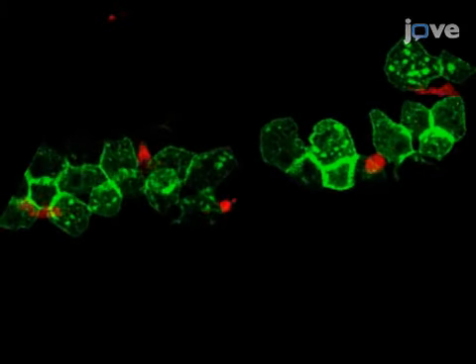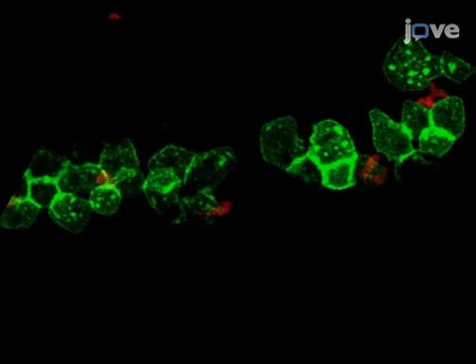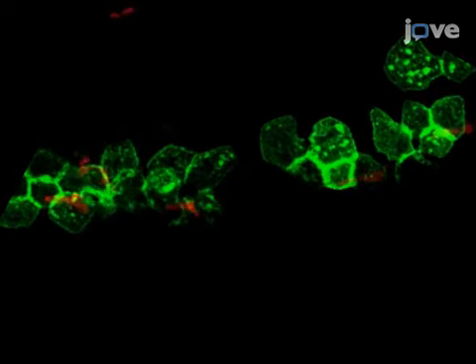Live imaging results show the interaction of innate immune cells with EGFP-HRAS G12V expressing superficial keratinocytes. The main advantage of this technique over existing methods like the classical Gal4 UAS or Cre-Lox systems is that expression can be activated and deactivated upon addition or removal of 4-hydroxytamoxifen.